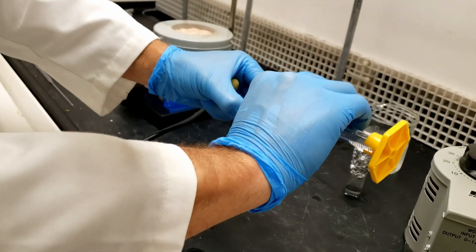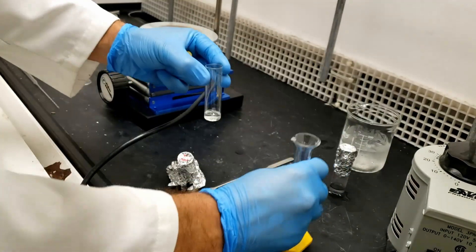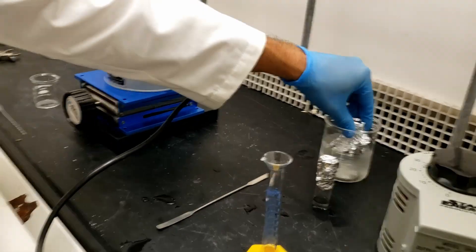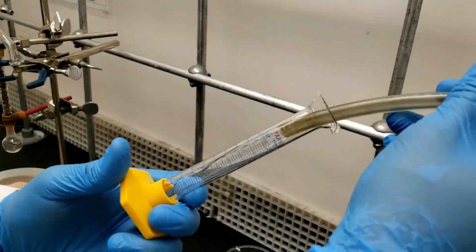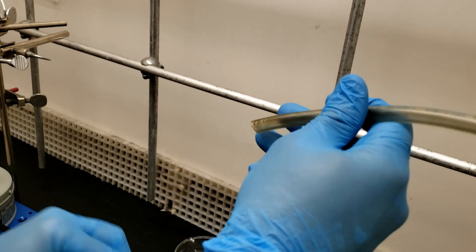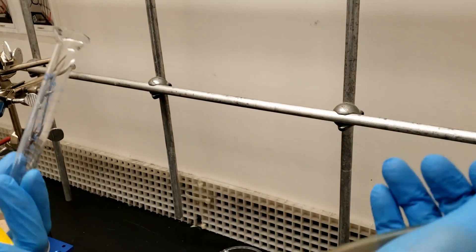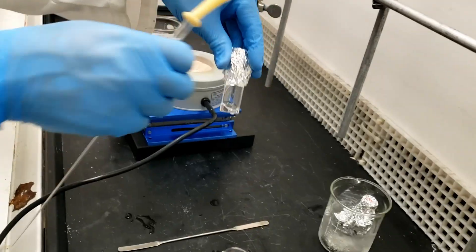Pour the fraction back into the vial to save it for GC analysis. Since gas chromatography is a sensitive technique we'll want to avoid contamination between the fractions. Make sure the graduated cylinder is dry using a stream of air in between measurements. Now we measure our fraction volume.